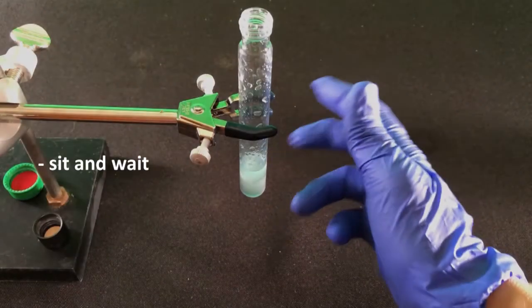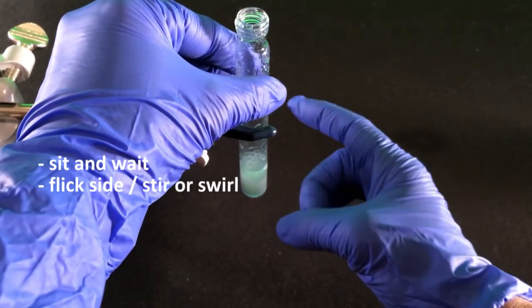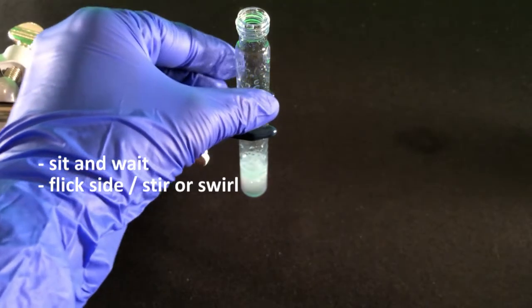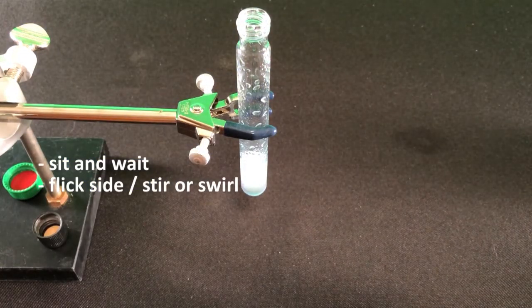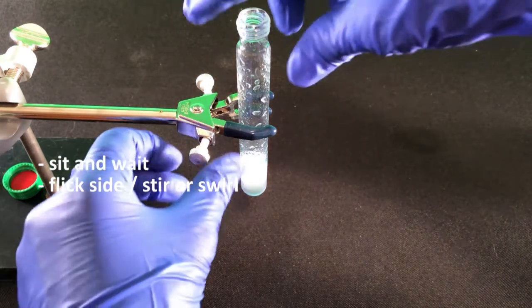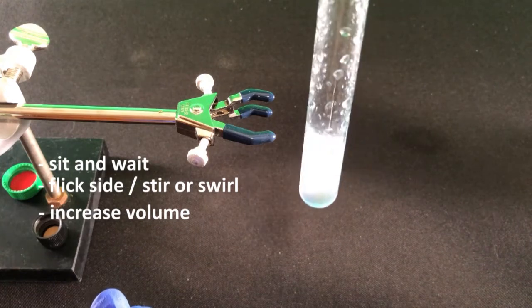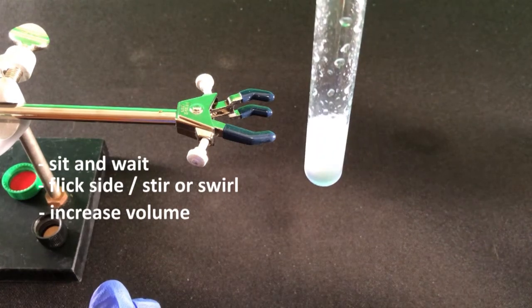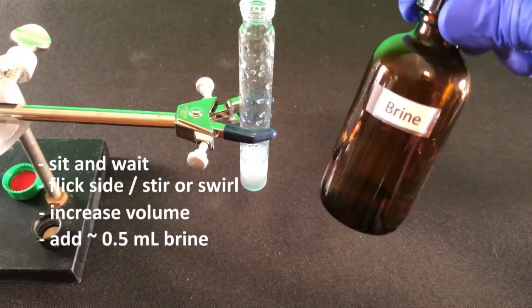If this is taking too long, you can stir and swirl the emulsion. Sometimes just flicking the side of the test tube with your finger will do the trick by encouraging the more dense solvent to fall out of the emulsion. If one of the layers has a greater volume than the other, add more of the lower volume solvent and gently swirl. Sometimes the addition of a little saturated sodium chloride solution will work.